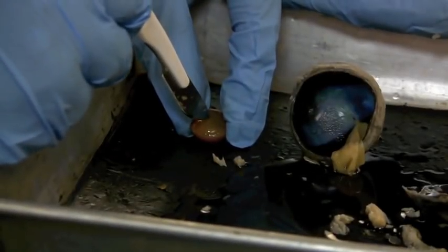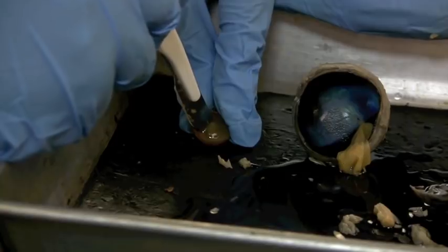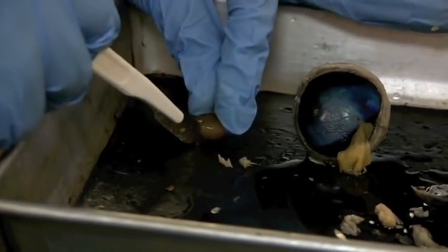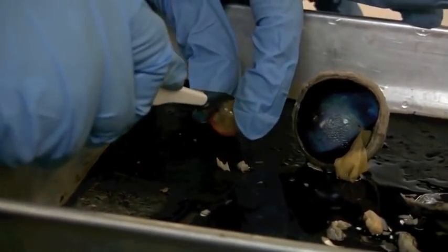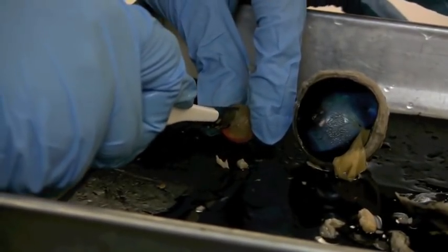I'm going to try and cut into it with my scalpel here, but it's a really hard substance and it's very slippery, so I don't want to cut myself. And here's where we film me going to the hospital.